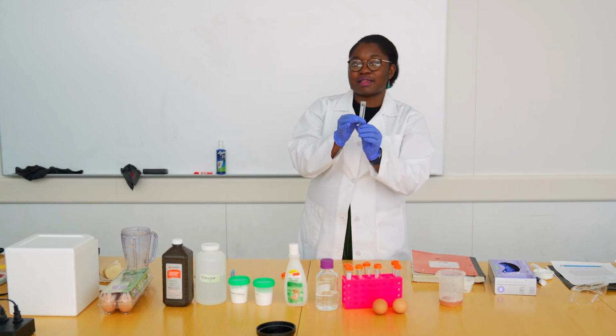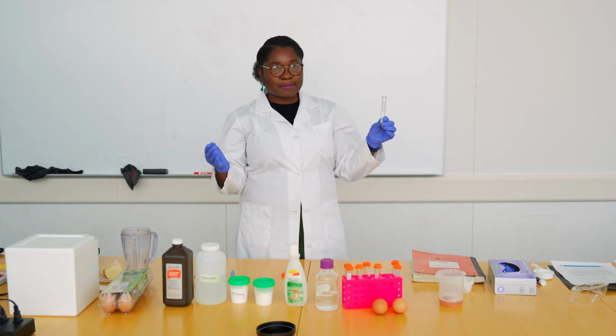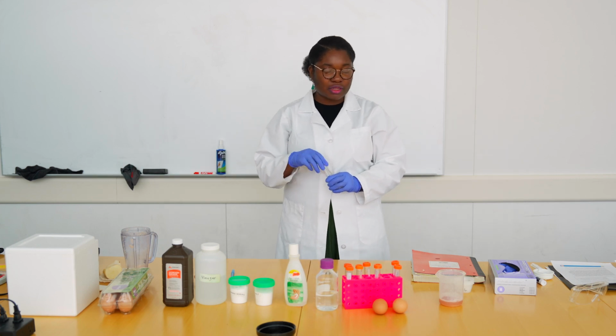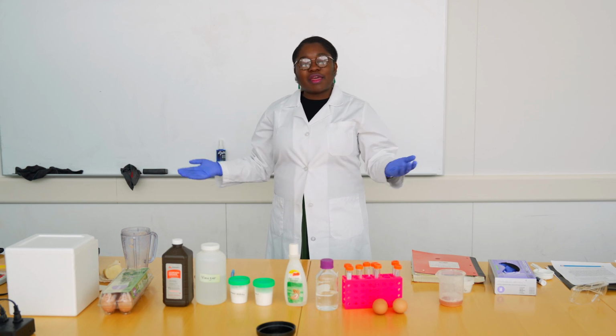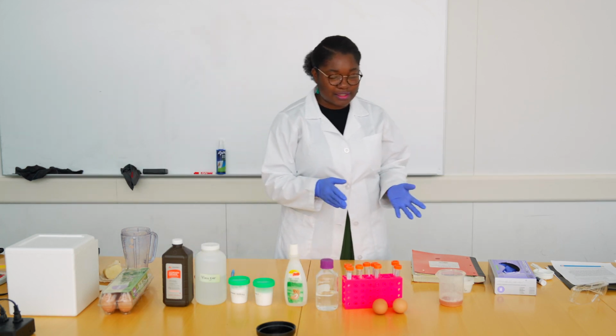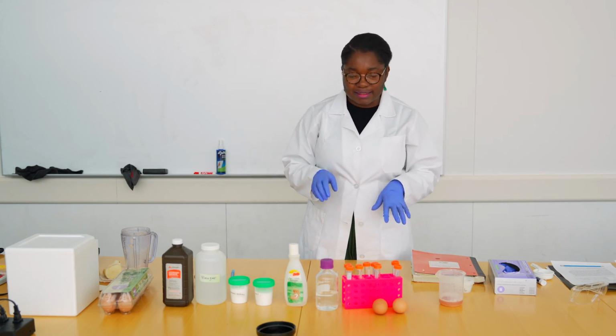But this is a nice example that you could replicate on things other than potato, like grass, and you could also find non-living material like salt, and any other thing that is not food might not have the same reaction, because our potato does have catalase in it.